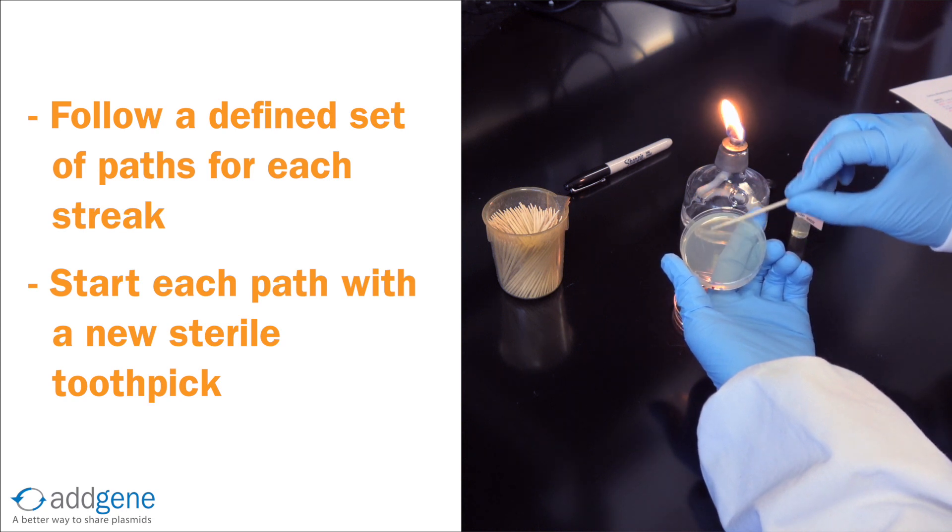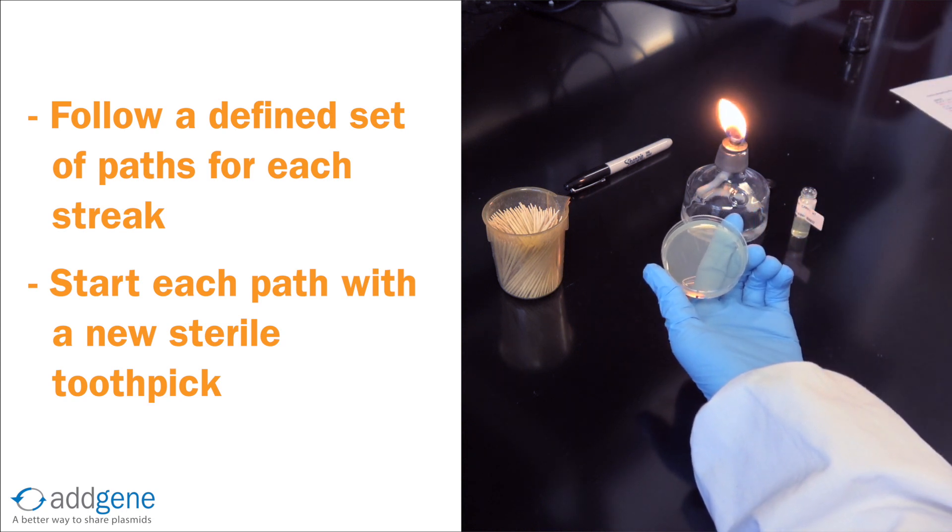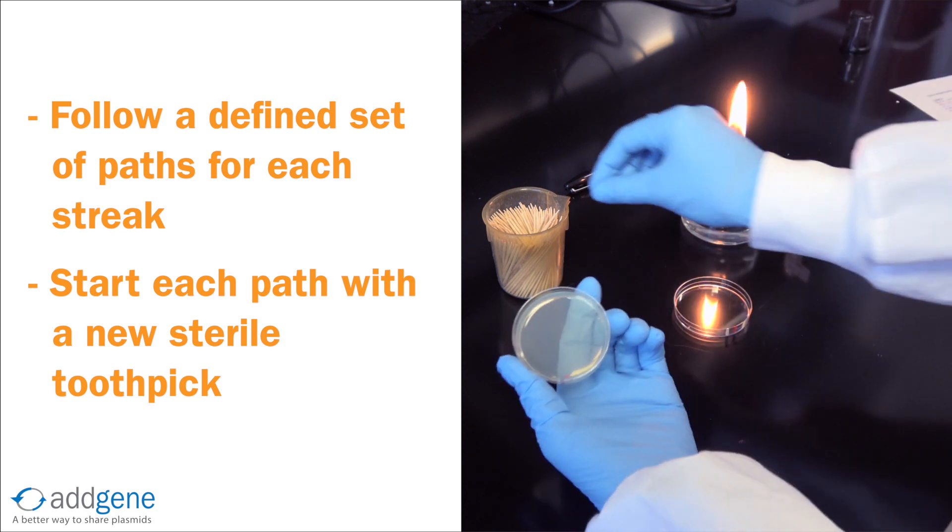With the first toothpick, we gently streak back and forth across roughly one-third of the plate, taking care to avoid the edges.